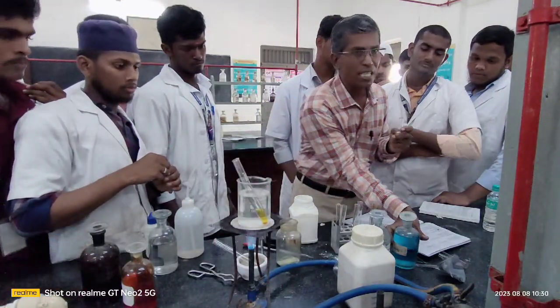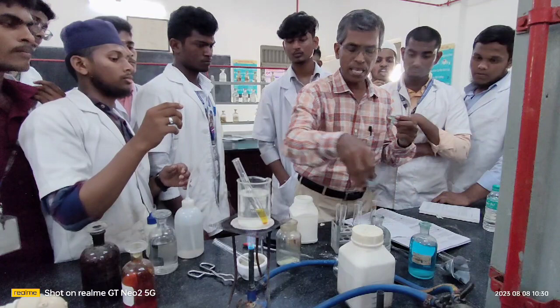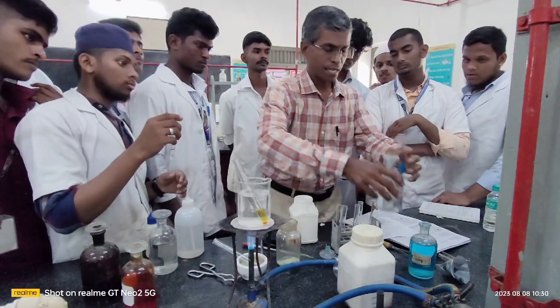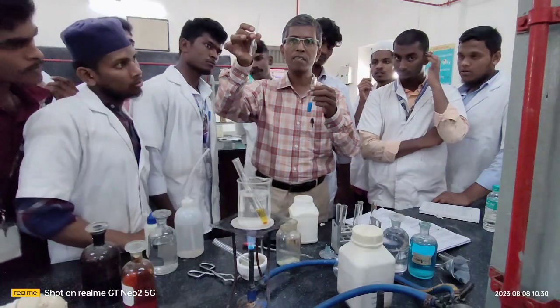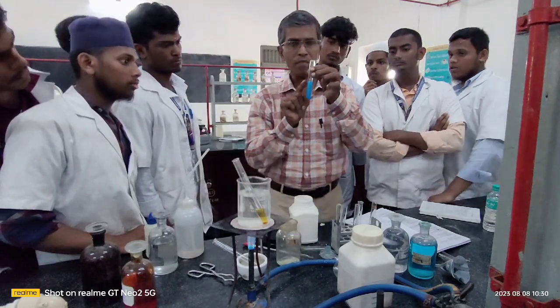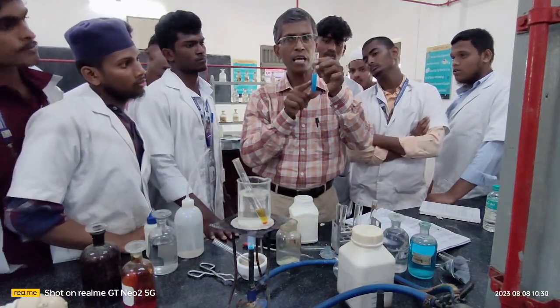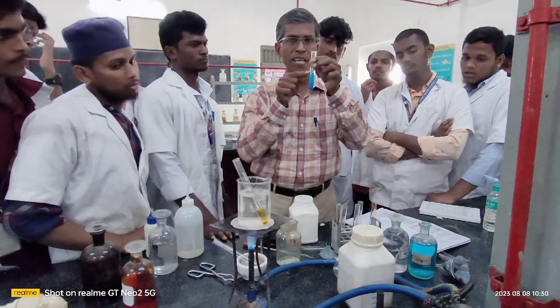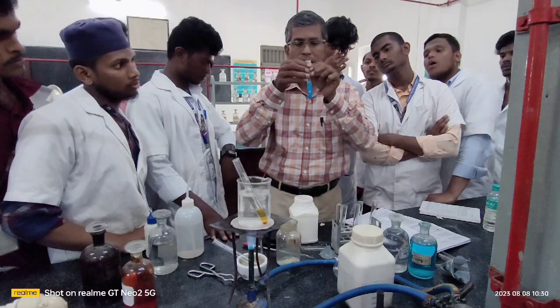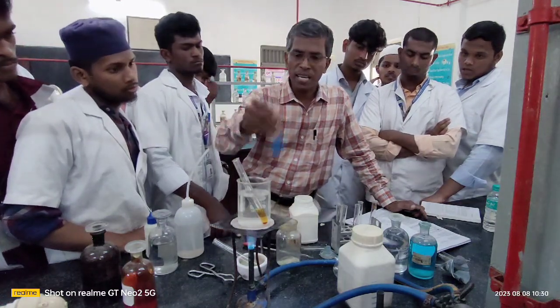In this you take Fehling's solution A, and you add Fehling's solution B into the A. Then you add your organic compound that we have taken in the form of water, that is, after dissolution, we have taken this solution. You add together the organic compound dissolved in water plus Fehling's solution A, that is nothing but your pure copper sulfate in water, and Fehling's solution B, that is potassium sodium tartrate plus sodium hydroxide, otherwise called Rochelle salt, and shake it well. And after shaking, you keep this also in the water bath for heating.